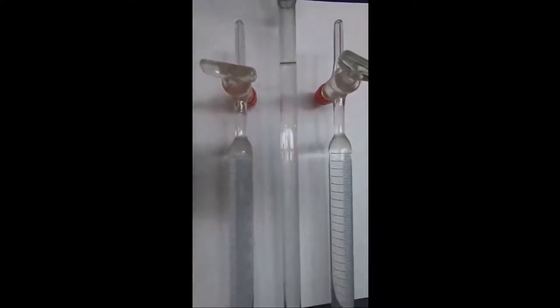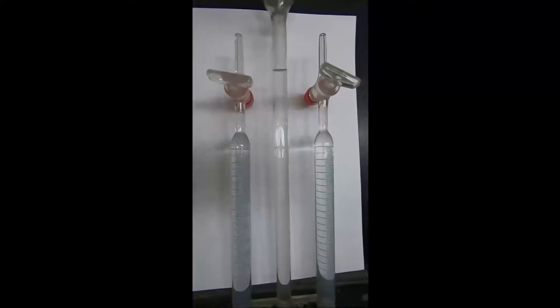Those bubbles of gas will pass up, but they can't escape because the taps are switched off. The gases are just going to collect in the top part of the tubes here, and we'll come back to them in a few minutes and have a look to see how much gas has been produced.